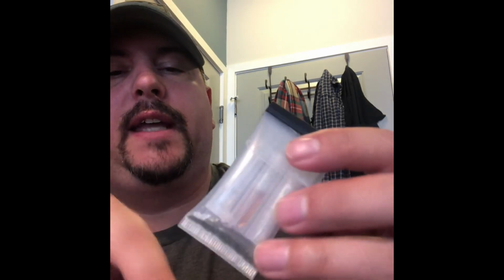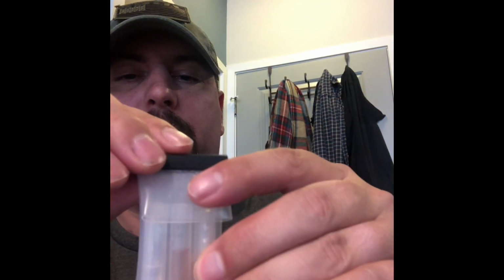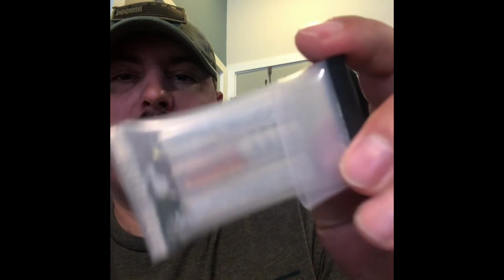Left to right. Again, off-colored liquid in the second ampule and the center ampule. Left to right, first ampule is broken, mixing that liquid with the substance.